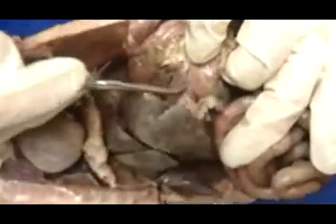This main part of the stomach is called the body. And then as we go on to the small intestine here, that's the pylorus. Okay, so that area is the pylorus. Within the stomach, we see some worms in this case, and the rugae, the surface area modification that we have here so that the stomach can expand.